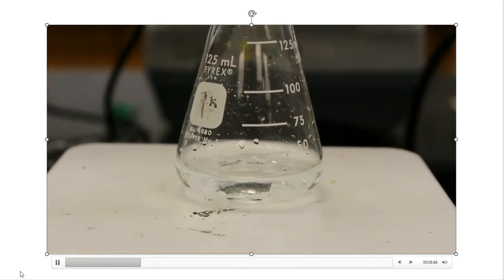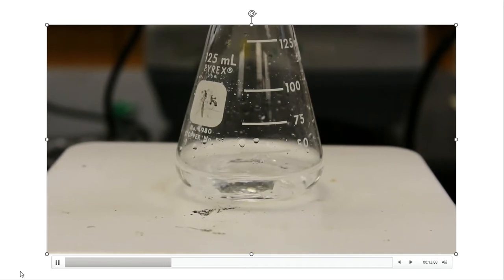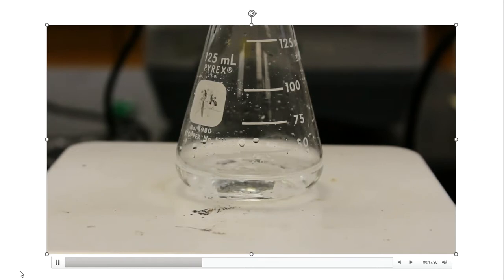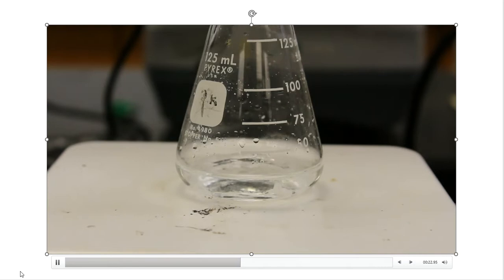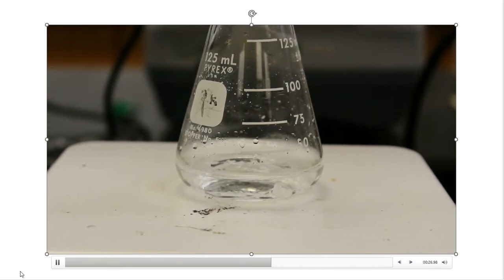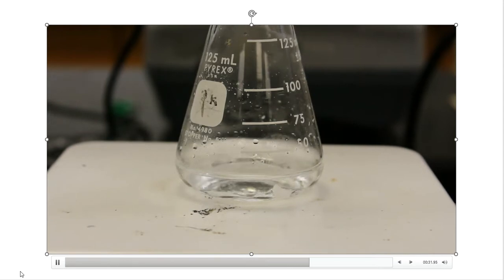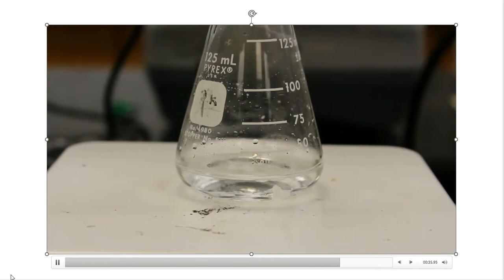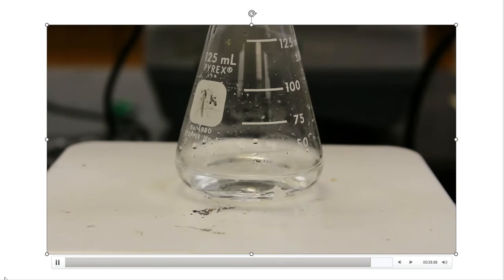The heat is on and the maleic anhydride is quickly dissolving, which is exactly what we want — all those crystals need to be in solution before the next step. If they're not dissolved, they won't be accessible to the reagents and can't react. The maleic anhydride shows very large flakes swimming around but is slowly dissolving.